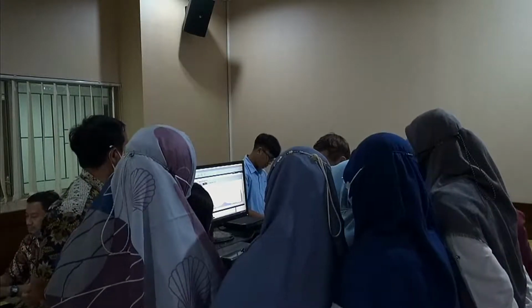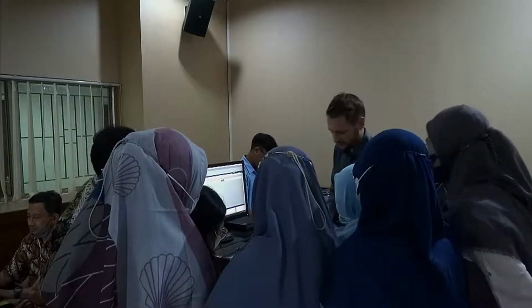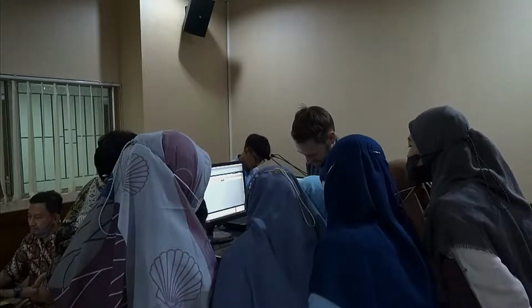And while it's, oh no, I need to do the cleaning. Actually, I don't have my hands free for checking. Yeah, I'm not used to this because usually I use, of course, the automatic procedure.